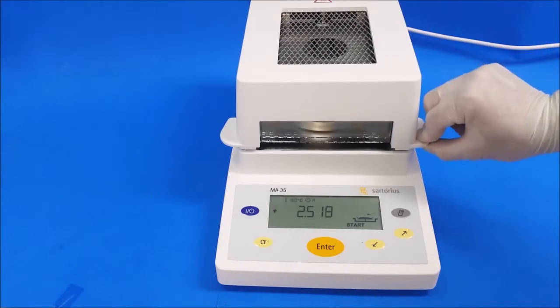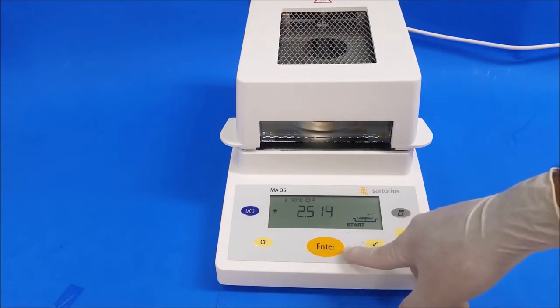Close the hood and now you press enter to start.